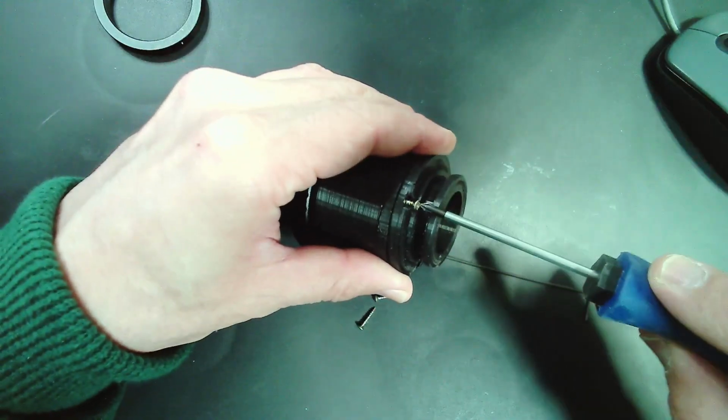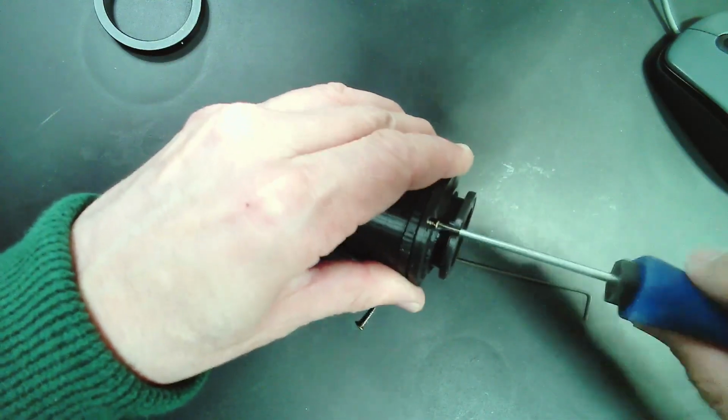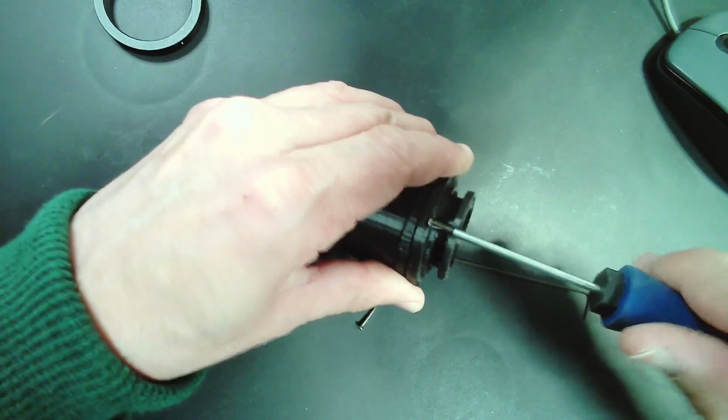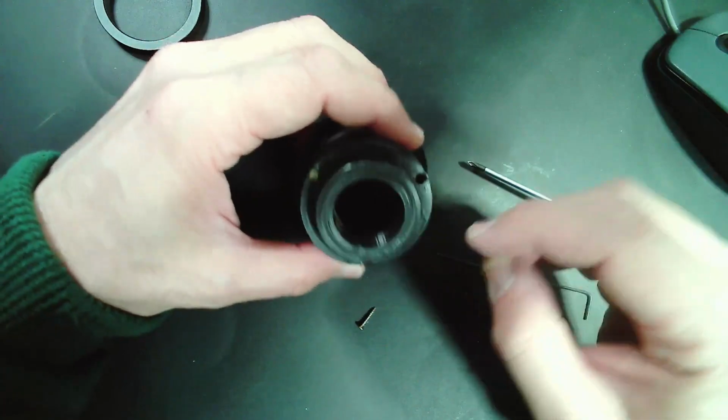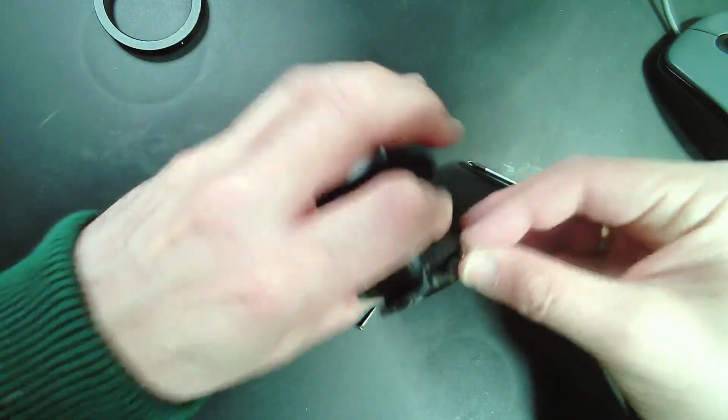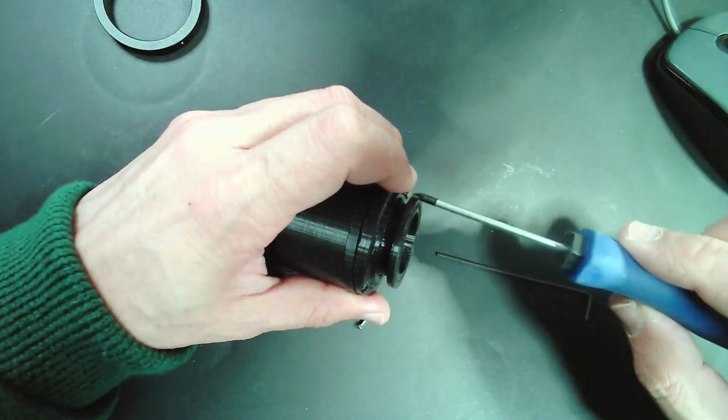And I'm quite happy with the adapter because it's quite stable and the image quality is quite good, of course, because I am avoiding any intermediate optics.